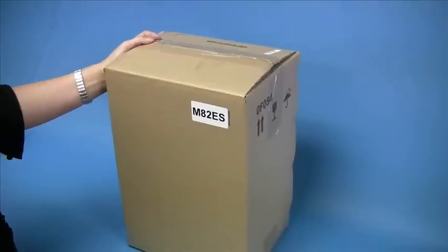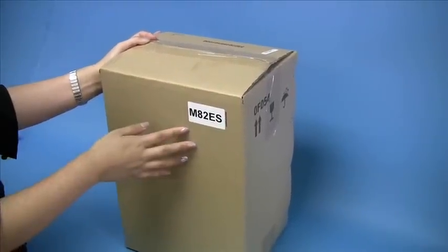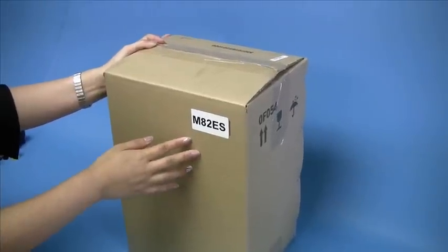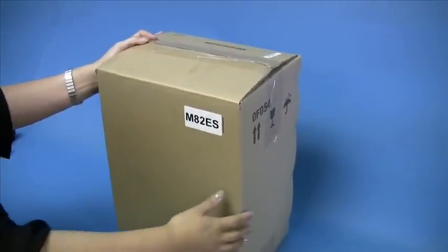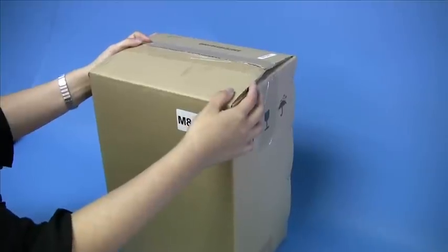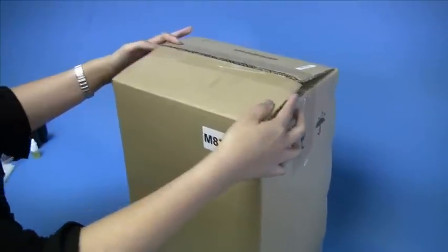Today I'll show you how to assemble and adjust a M82ES OMAX microscope. Once you receive your package through mail, open the carton box carefully using a knife or paper cutter.